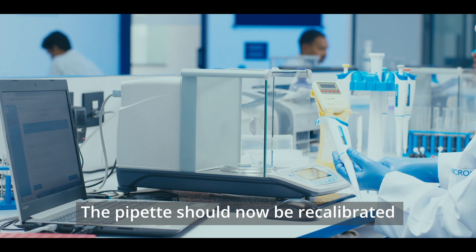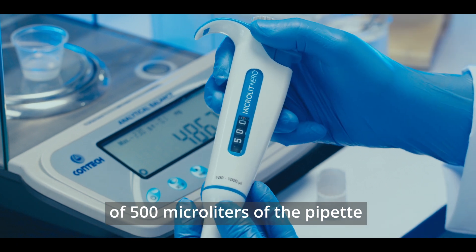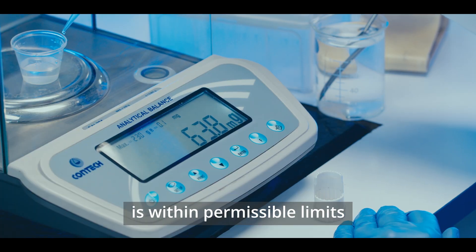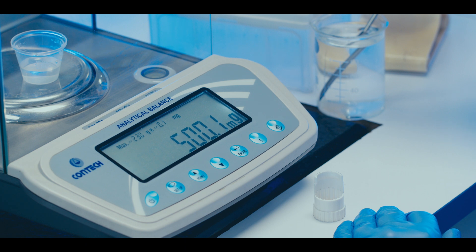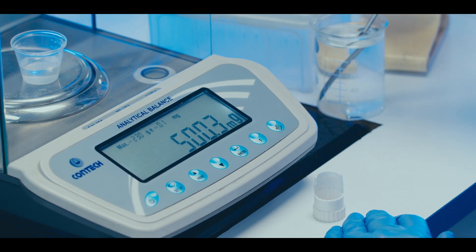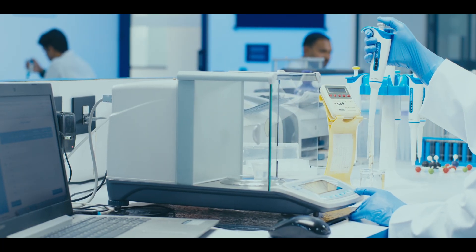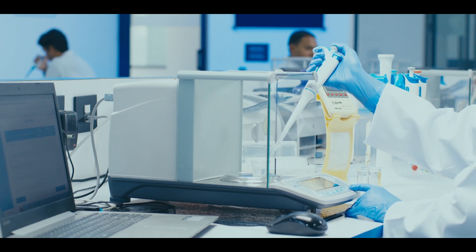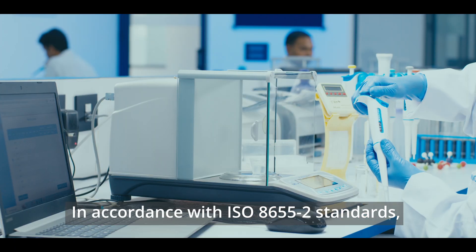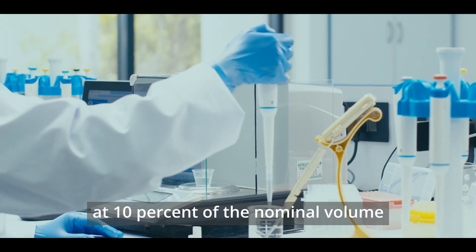The pipette should now be recalibrated. Adjust the volume back to the original volume of 500 µL and perform at least 5 measurements to check whether the recalibrated volume is within permissible limits. In accordance with ISO 8655 standards, also check the calibration of the pipette at 10% of the nominal volume and at the nominal volume.